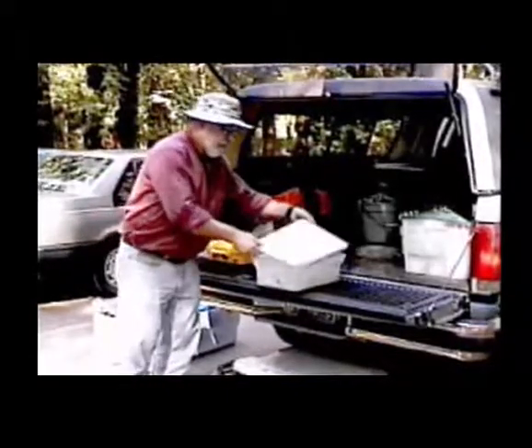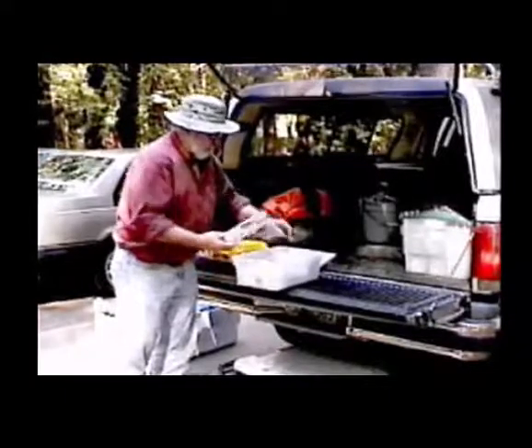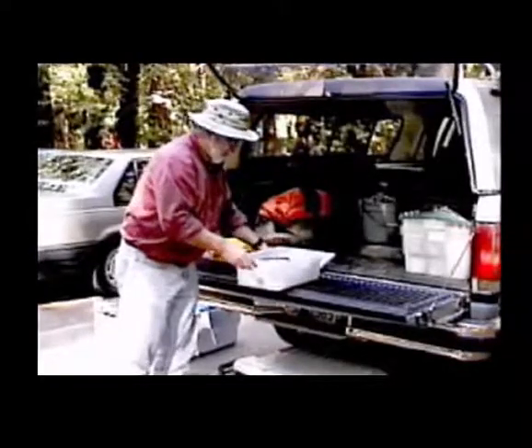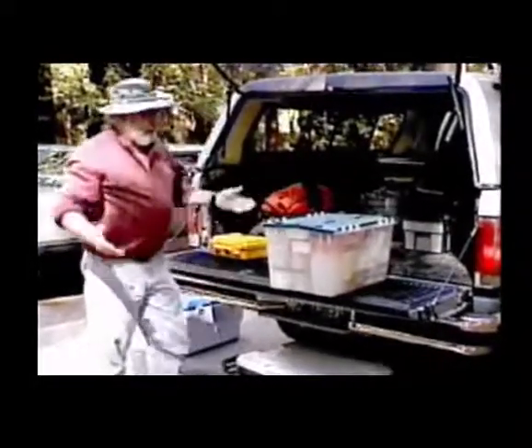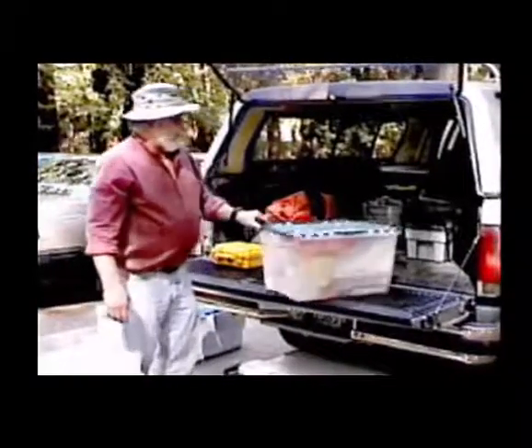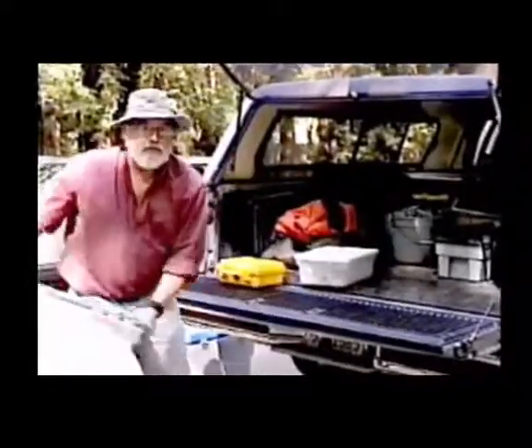Very inexpensive plastic box. Very good for handling. These are discrete, smaller water quality meters, instruction books, things like that. Anything, virtually anything. We then have, again, very standard container. This particular container I use for all my personal sampling equipment. I can just grab it and go anytime.